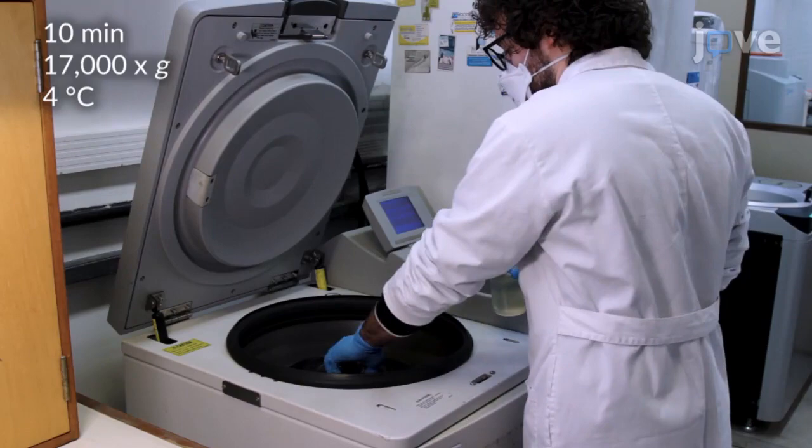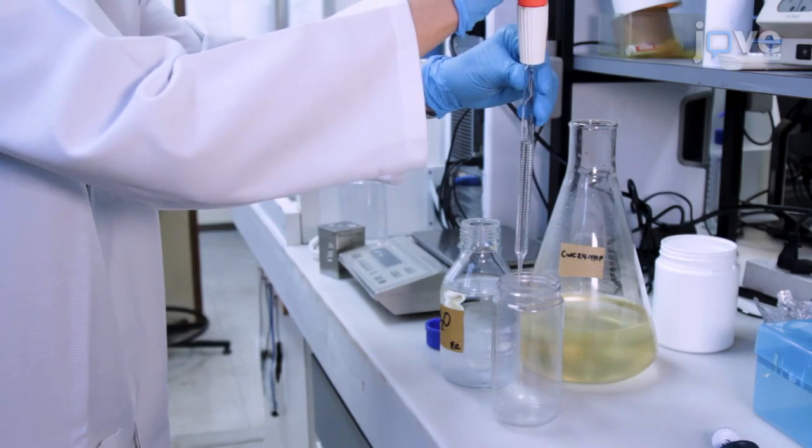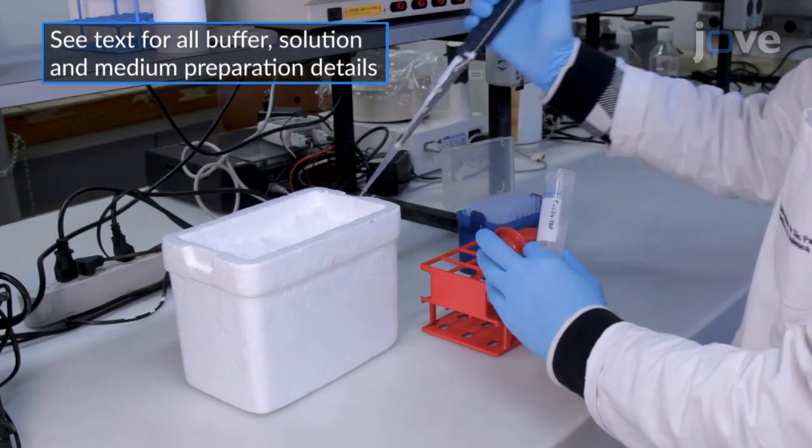When the culture reaches an optical density at 600 nanometers of 1, collect the yeast cells by centrifugation in three 500-milliliter centrifuge bottles and wash the cells two times in 10 milliliters of cold sterile water per wash.